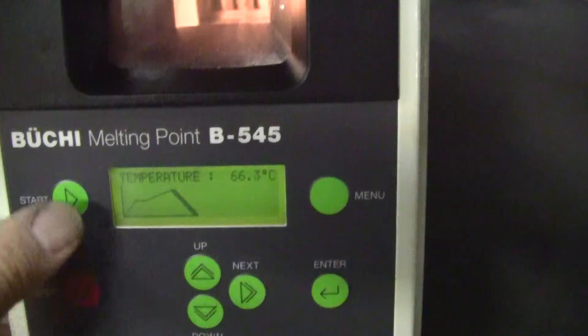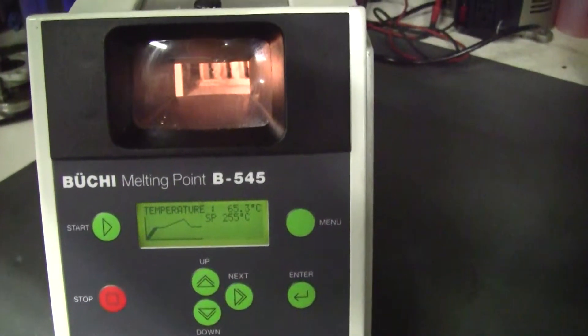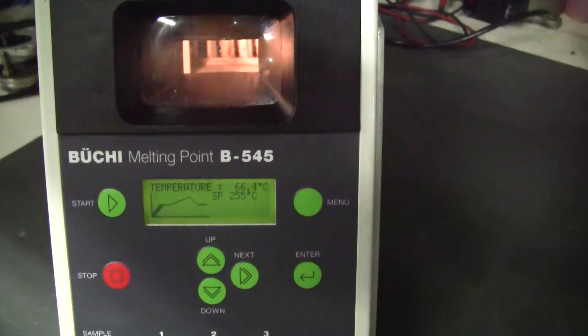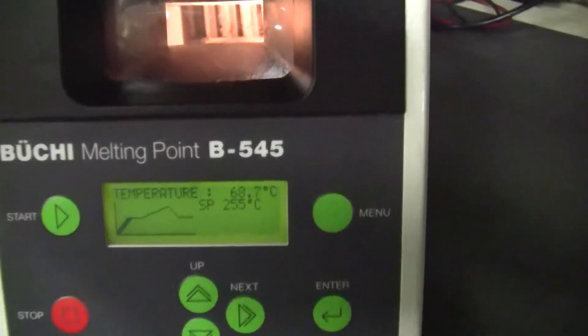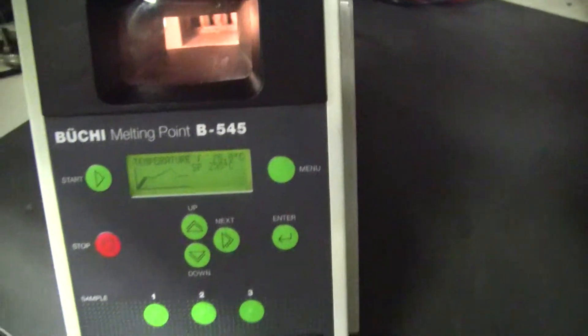It's cooling. I'm going to hit stop, I'm going to hit start. And look at that start to, we should see it start to ramp up momentarily. Heater's working.